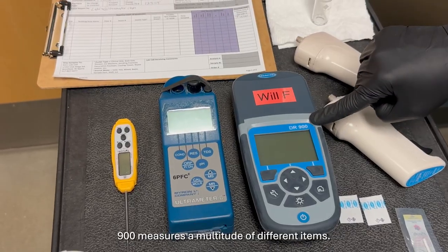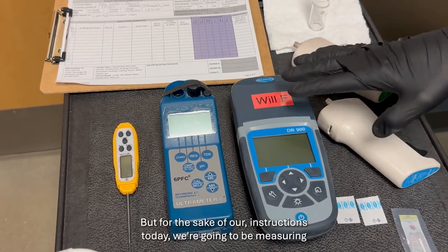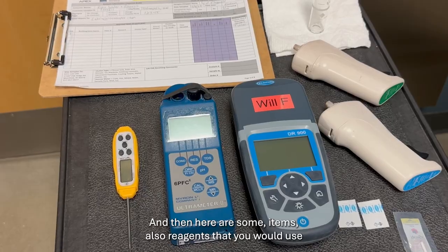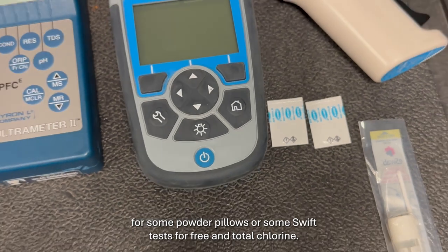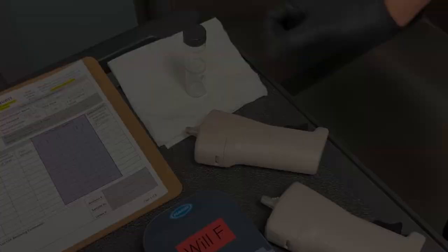This particular DR900 measures a multitude of different items. But for the sake of our instructions today, we're going to be measuring chlorine. And then here are some items, also reagents that you would use, some powder pillows or some Swift tests for free and total chlorine, and your vial that you would use to fill up the sample.